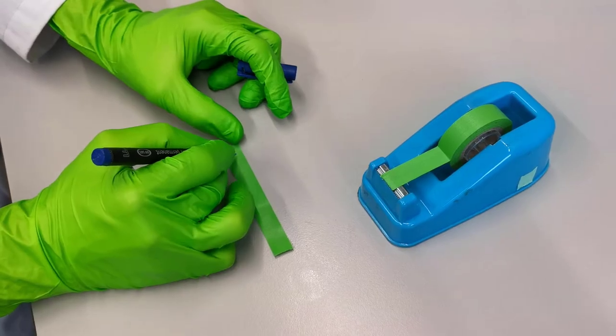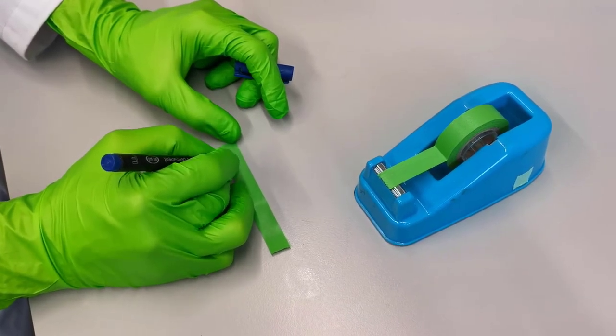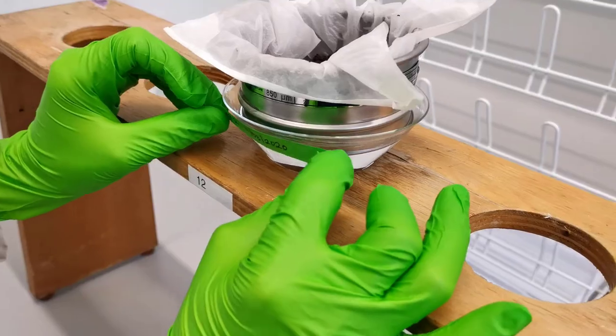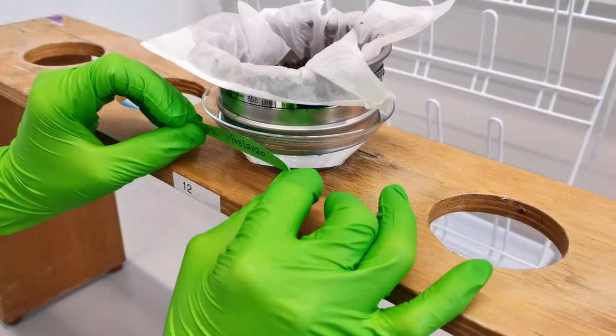At this point, labeling your extraction funnel clearly indicating sample codes, date of extraction, your name, etc. are important.